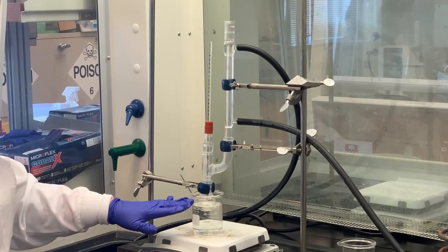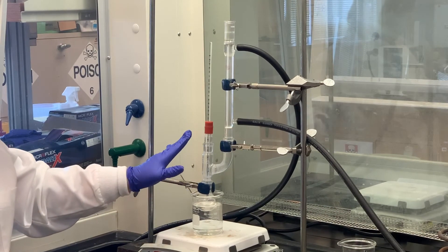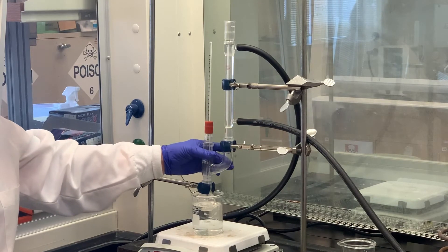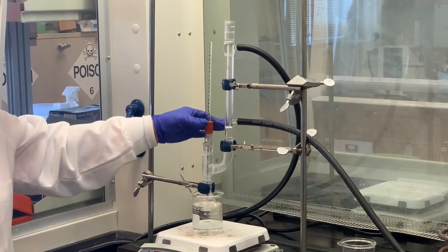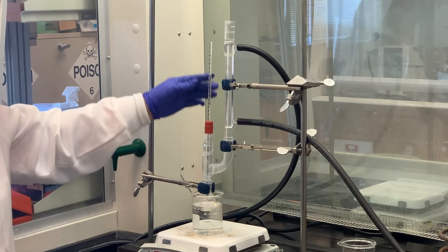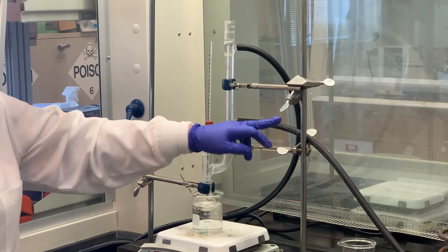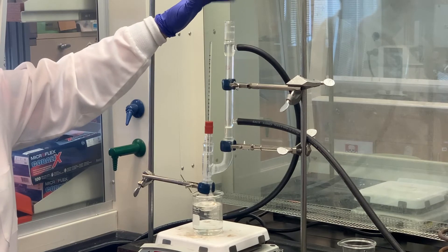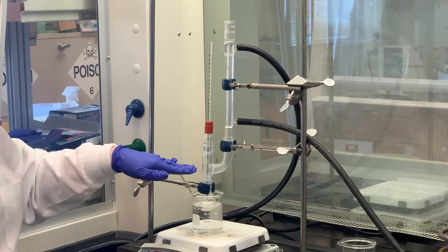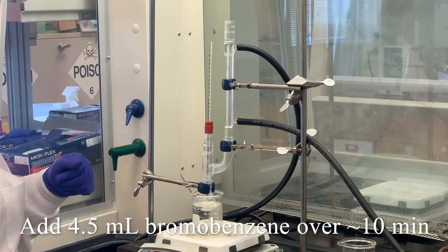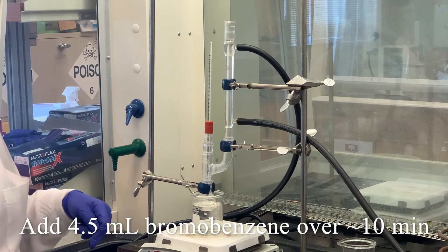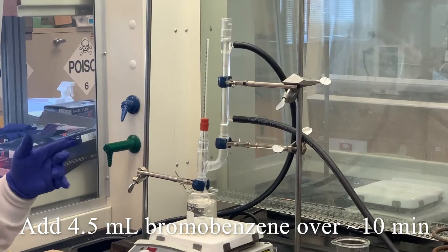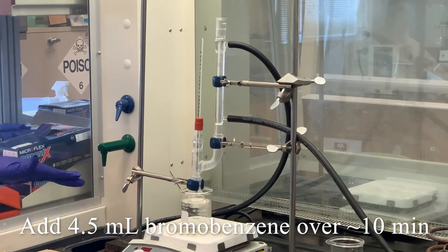The temperature of the nitric acid-sulfuric acid mixture was around 25 degrees. I went ahead and set up the Claisen adapter here, which has the thermometer adapter attached with the thermometer inserted. Here's our condenser, water going in the bottom, out the top. We're going to add the bromobenzene through the top of the condenser. I've got my mixture stirring. We're going to add the bromobenzene - we've got 4.5 milliliters that we're going to add, but I'm going to add it in half milliliter increments over about a 10 minute period.